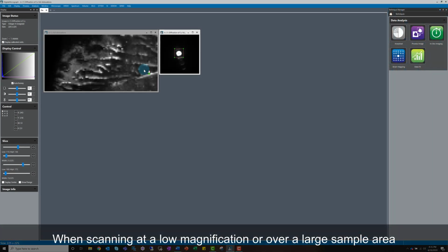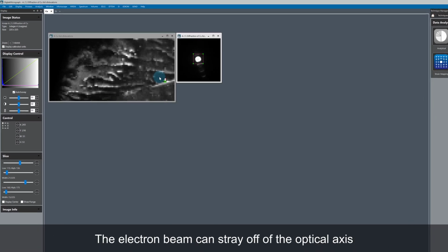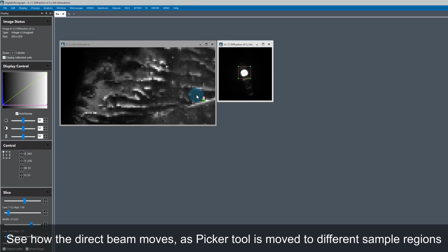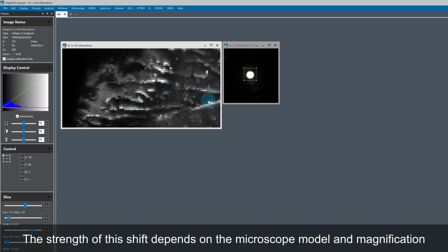In scanning mode, mostly when scanning at lower magnifications or over a large area of the specimen, the electron beam can stray off of the optical axis. You can see this in the example I'm showing here. As I move the picker tool, the direct beam marked by the ROI on the diffraction image moves around. The strength of this shift depends on the microscope model and the magnification.